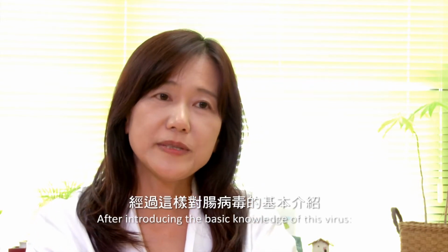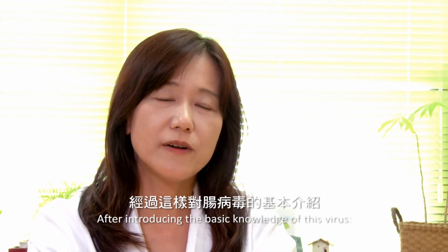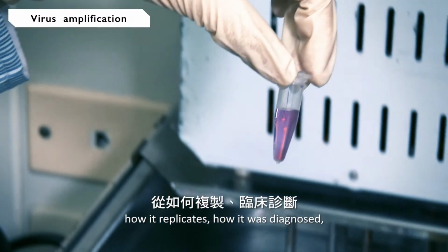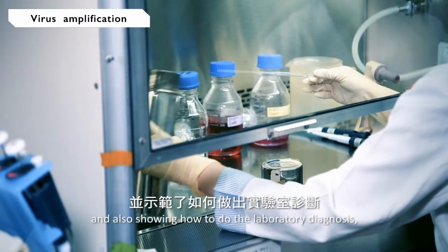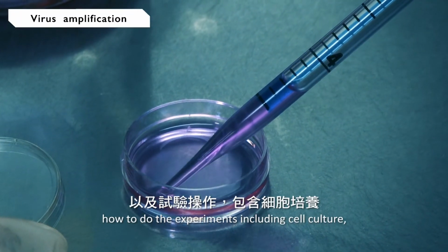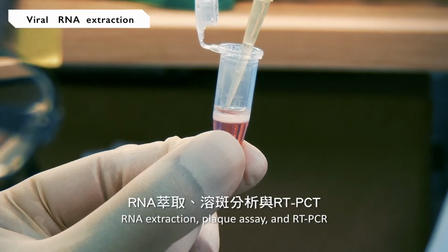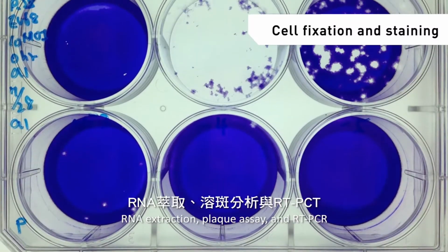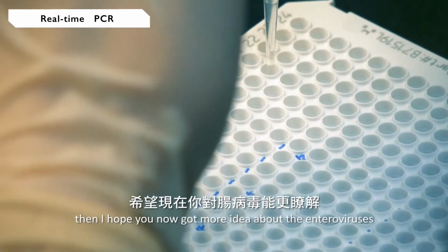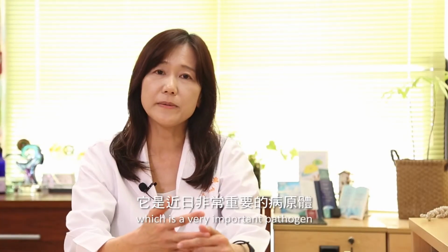After introducing the basic knowledge of this virus, how it replicates, and how it is diagnosed, I also showed you how to do the laboratory diagnosis, including cell culture, RNA extraction, Plaque assay, and RT-PCR. I hope you now have more idea about enteroviruses, which are a very important pathogen.